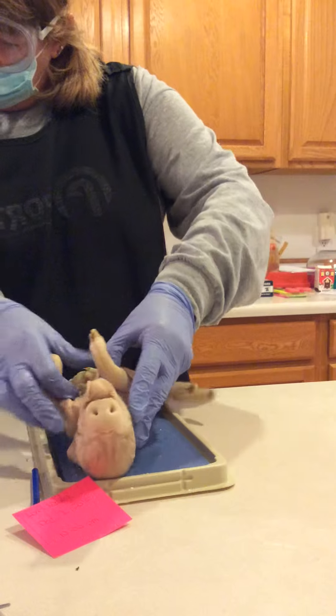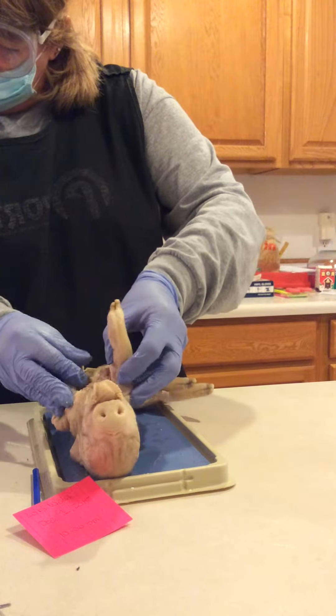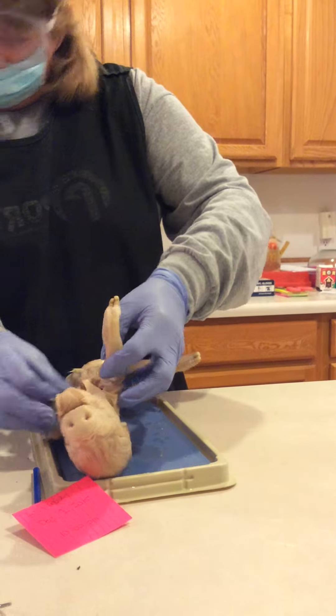The two halves of the thymus gland must be spread apart, and the muscle below them removed to expose the area.